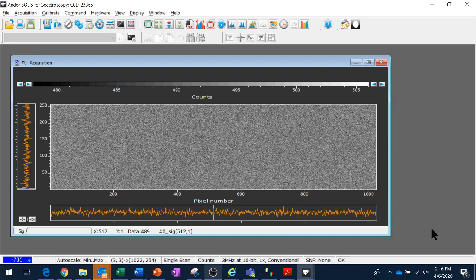And in this very short video, I want to explain the detector bias or offset in scientific cameras, both CCD and sCMOS, and how to correct for it. So here's a raw acquisition from my CCD camera that I have hooked up, a Newton 920 BEX2DD, which has a cover over the sensor and should be pretty light tight. Yet, I still have what looks like hundreds of counts at each pixel.